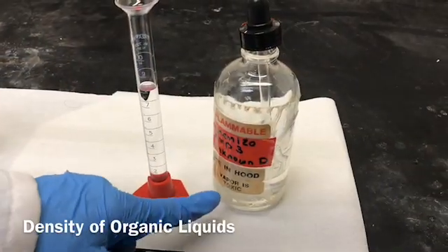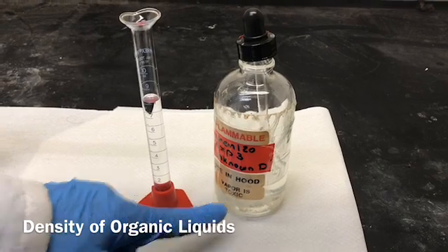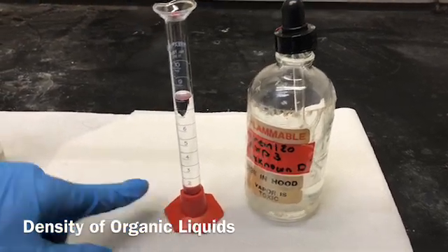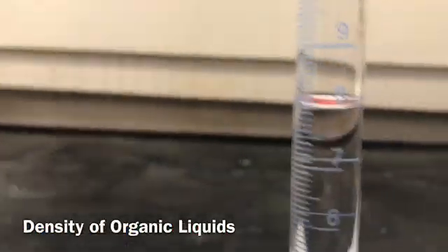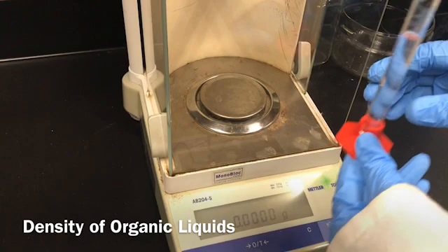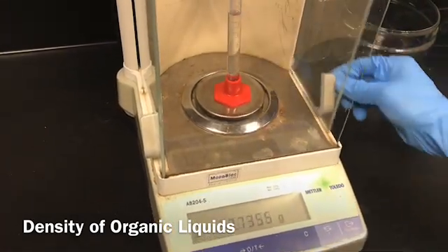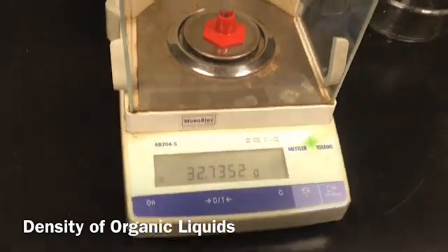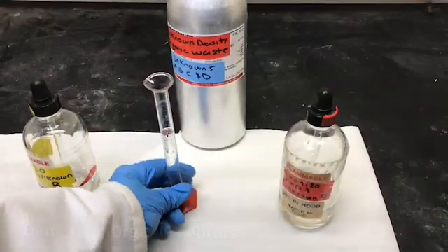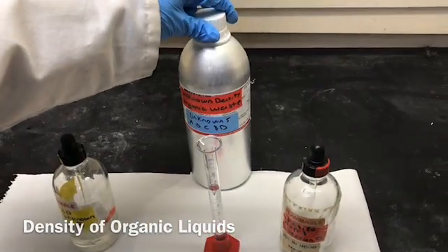So now I added between 7 to 9 milliliters of D into the measuring cylinder. You can note down the volume reading. Mass of unknown liquid D and the measuring cylinder. So I'm going to dispose of now my unknown liquid D into the waste container.